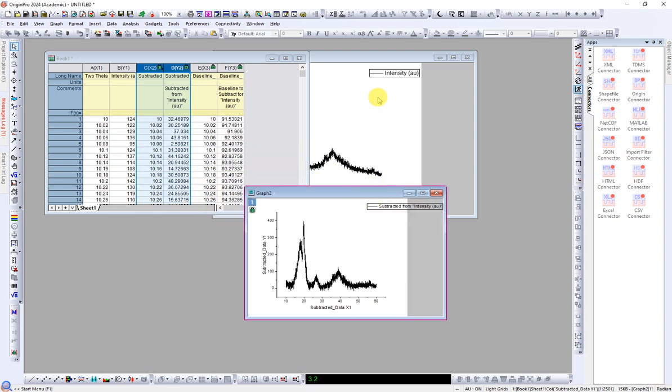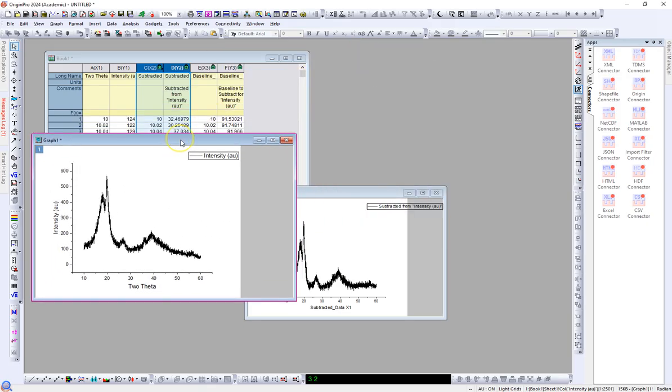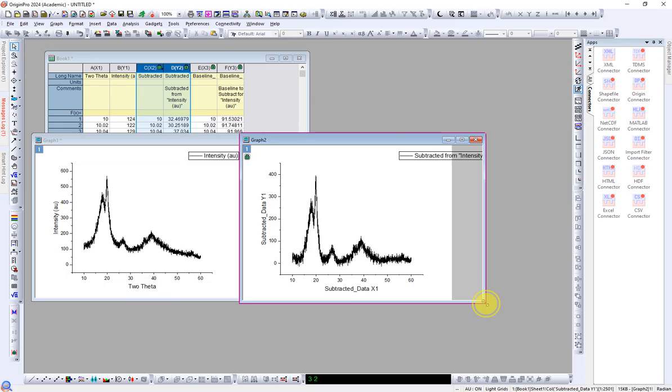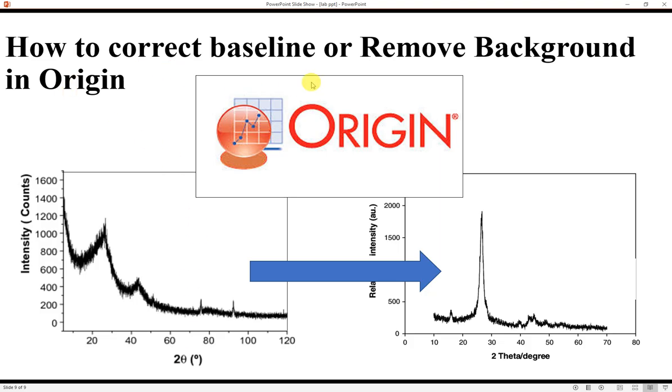So here you can see, compared to this graph, the baseline is subtracted, as it starts around 0 and it looks much better. So this is the way we can correct the baseline, or remove the background, of XRD or any other curve using Origin, which is very simple and straightforward.